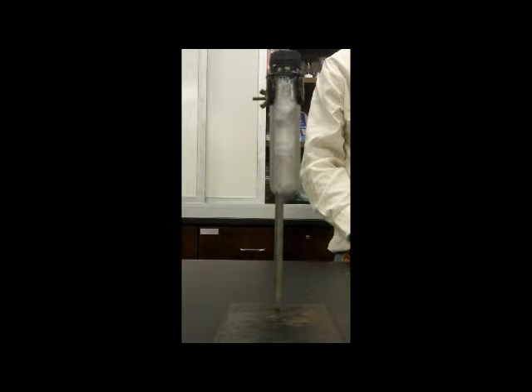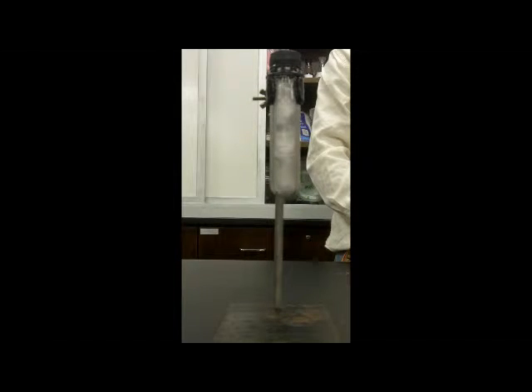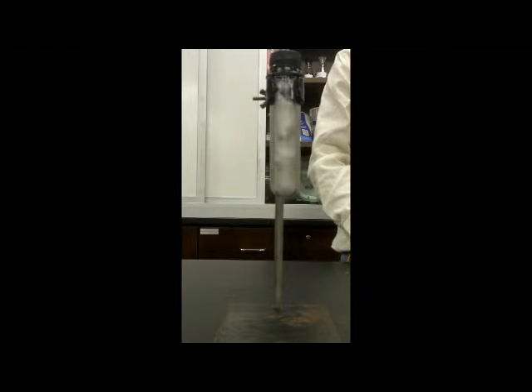You can put your clothes in a very high pressure washing machine filled with dry ice, and it'll go to liquid, and it turns out to be a really good solvent for things that you might take to a dry cleaner. So it's starting to get wet, it's starting to condense down, the pressure's going up, and as soon as it gets high enough, it has to get above something called the triple point. Once it gets higher than the triple point pressure, we're in good shape. We're going to have some liquid carbon dioxide.